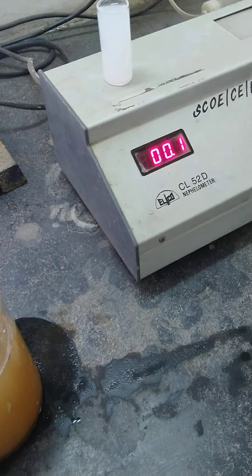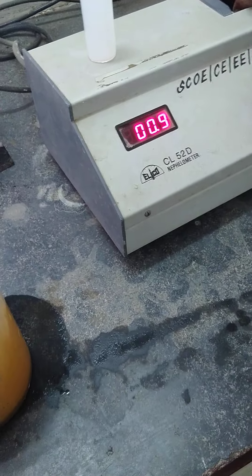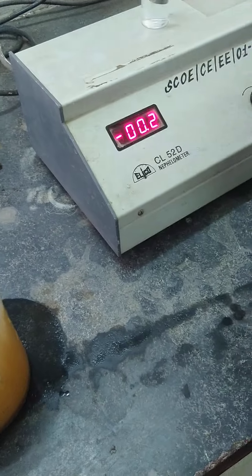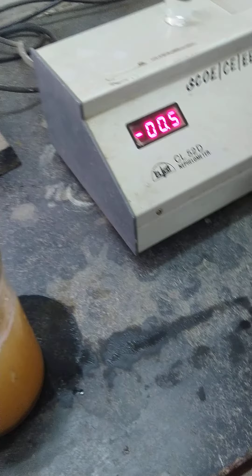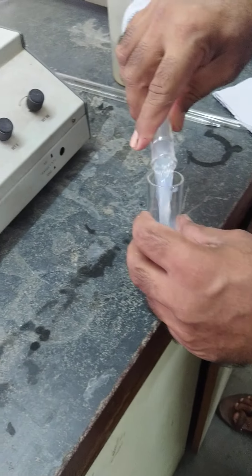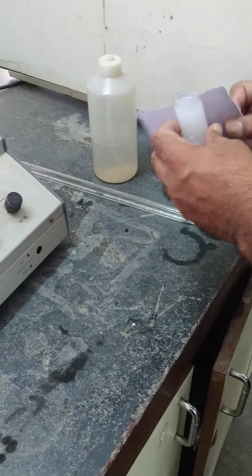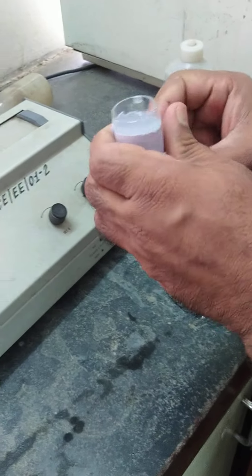The instrument is set to zero. Now we will put the other solution — the standard solution of 100 NTU turbidity. This particular solution prepared has a turbidity of 100 NTU. We put it in the nephelometer, and this tube is required to be cleaned from outside.